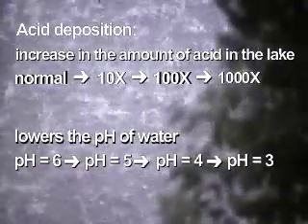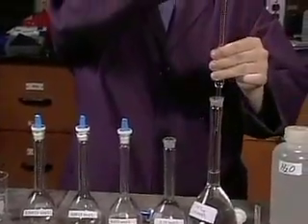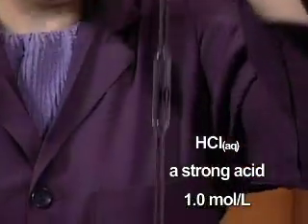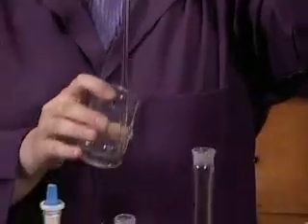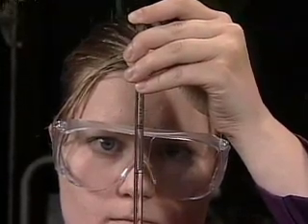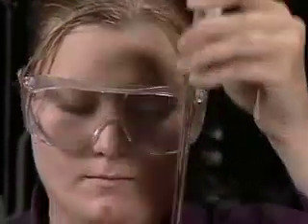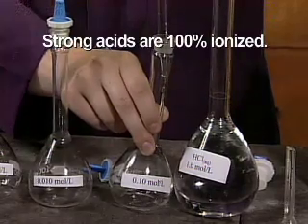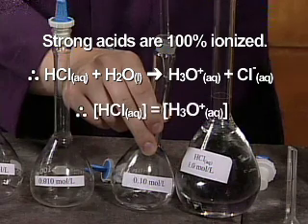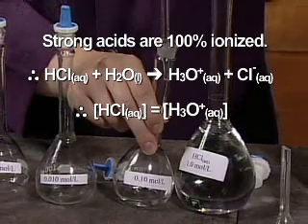To create solutions of pH 6 and lower for studies, biologists can dilute a strong acid of known concentration. Hydrochloric acid is a strong acid. 10 milliliters of 1.0 mole per liter hydrochloric acid are added to a volumetric flask using a volumetric pipette. Hydrochloric acid ionizes completely in water. Therefore, the concentration of the hydronium ion being added to the volumetric flask is equal to 1.0 mole per liter.